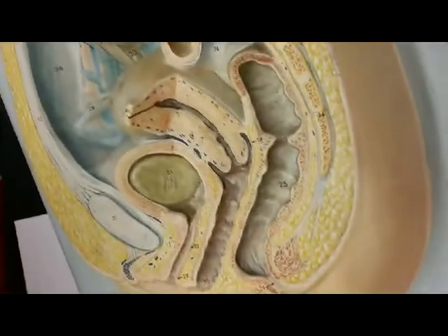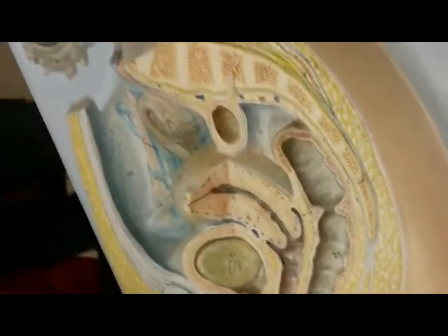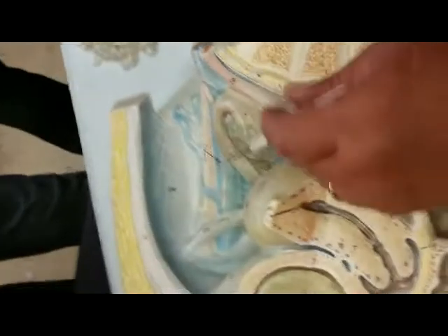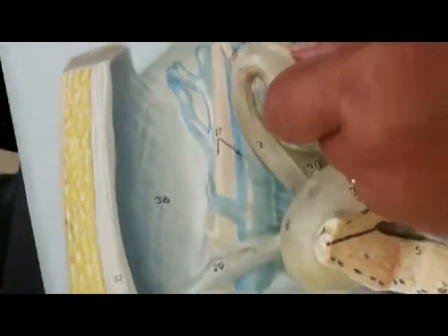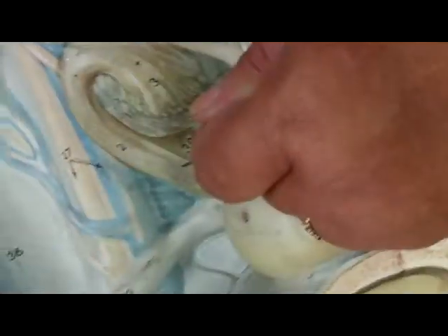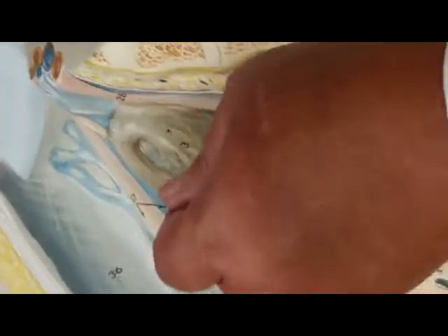No? I'm going to add to your list the finger-like projections that hang over the ovary to catch the egg when the woman ovulates. It's called the fimbriae. I'll put it on the board, fimbriae. So here's the ovary, fimbriae. And what is this now, ladies? Fallopian tube, otherwise known as the oviduct, otherwise known as the uterine tube. So you can say fallopian tube, you can say oviduct, or you can say the uterine tube.